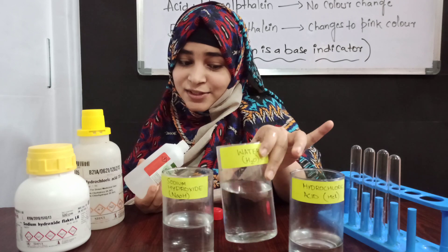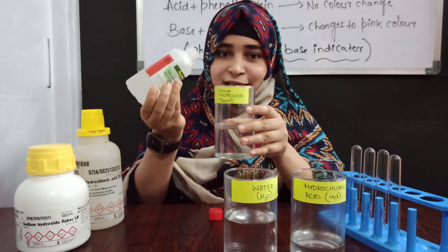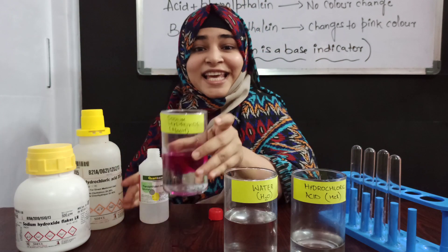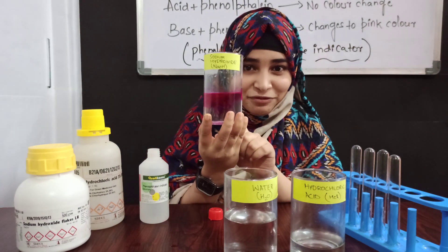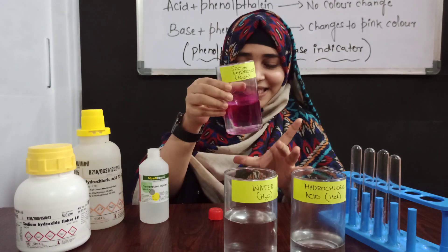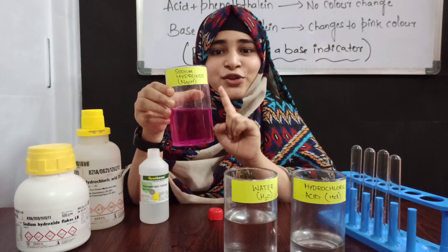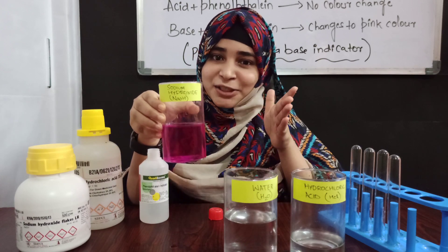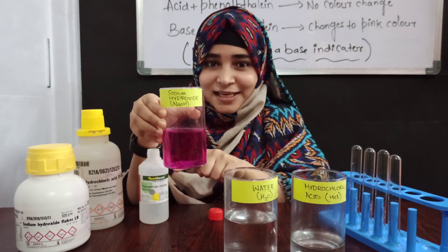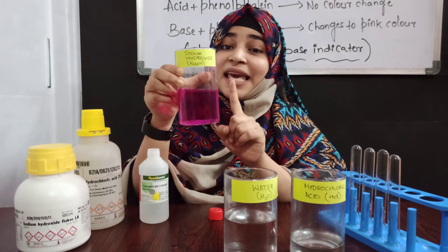But if I add the phenolphthalein indicator into the basic solution, as you can see — wonderful! It changes its color to pink. This is so beautiful. It indicates that this solution is the base. So whenever we add phenolphthalein solution into the acid — no change in color; into the water — no change in color; but into the base — it changes its color to pink, indicating the solution is a base.